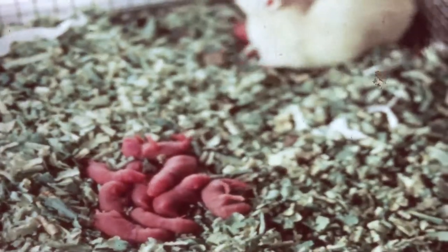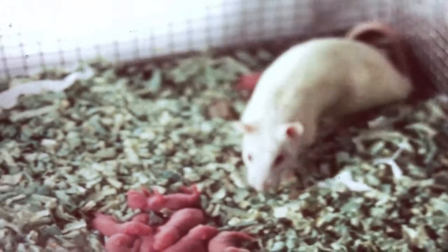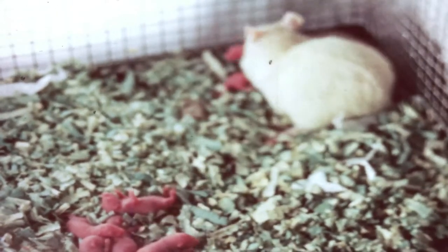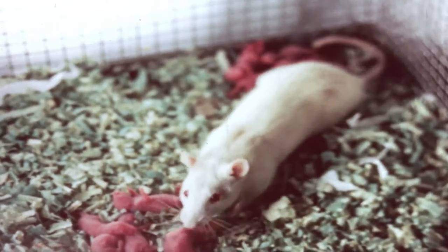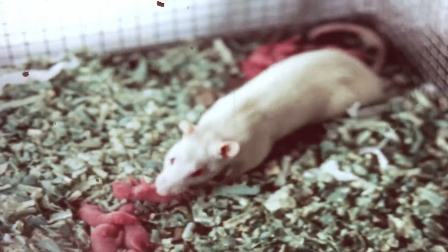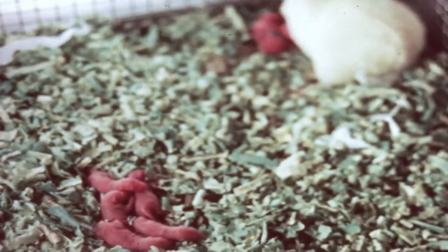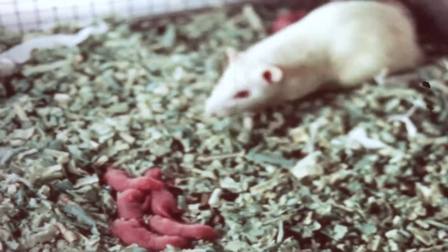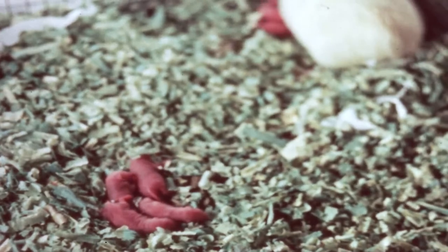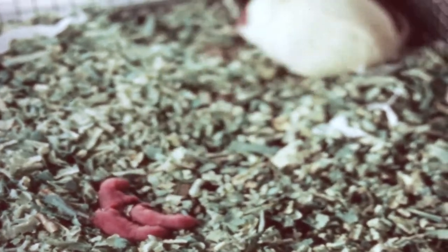The laboratory rat, more than any other mammal, demonstrates various internal and external changes which occur during a single reproductive cycle. Numerous observations have shown that these changes may be demonstrated by a variety of methods and at close intervals without disturbing their normality.